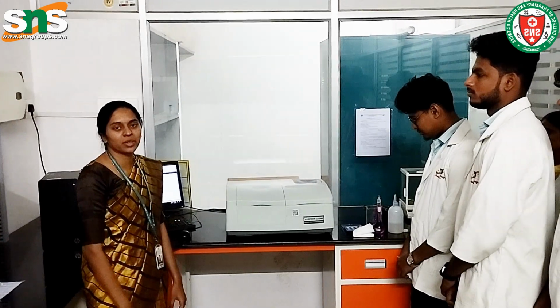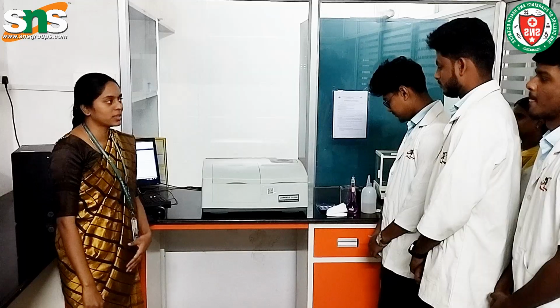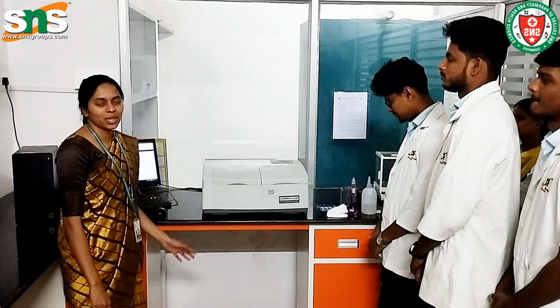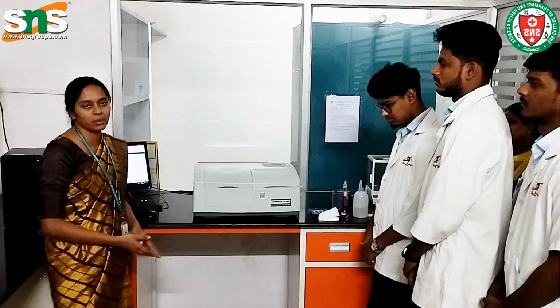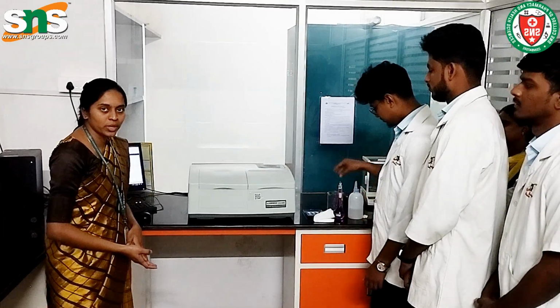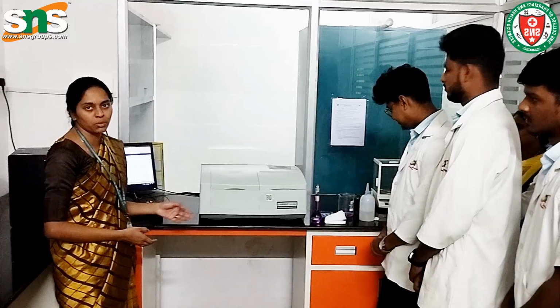In this lecture we are going to determine the lambda max of the given sample. The given sample is potassium permanganate. Potassium permanganate is an oxidizing agent and its color is purple. We are going to determine its lambda max with the help of a UV-Visible spectrophotometer.